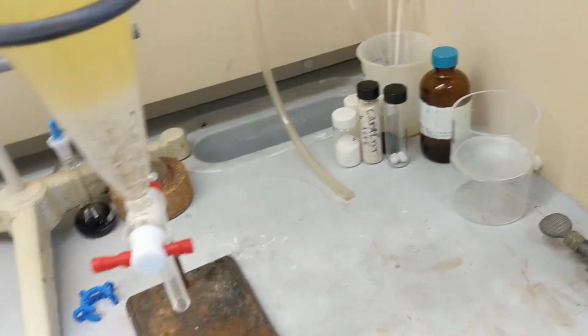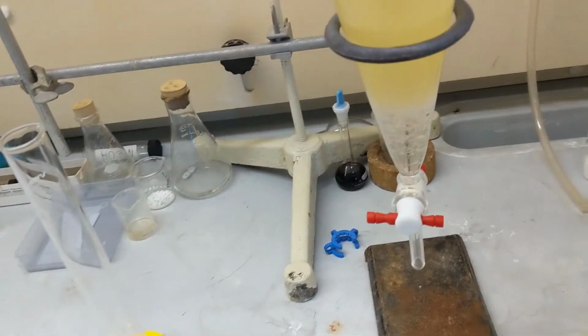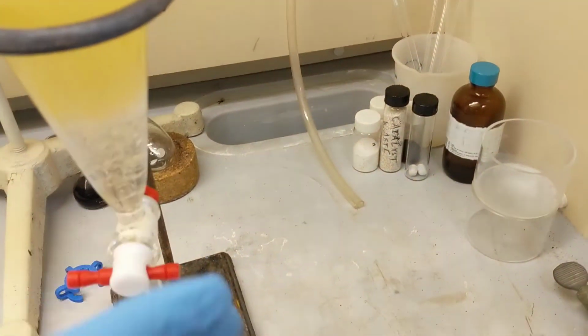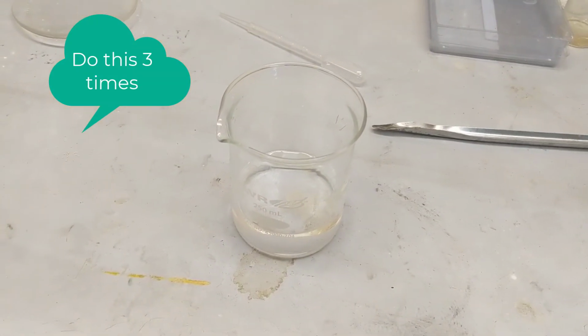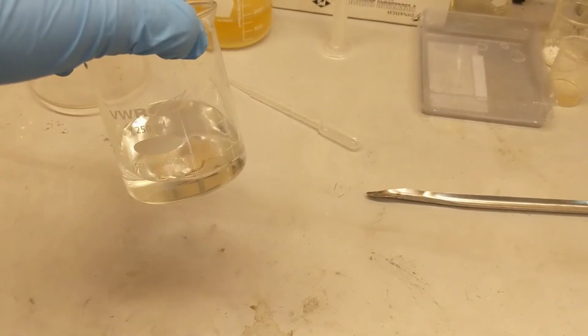Now, you know what to do from here. Same thing we always do. Shake it a little, release pressure, shake, release pressure. Try to get our product to move into our organic layer. Alright guys, after 3 extractions with methylene chloride, I have my product right here.